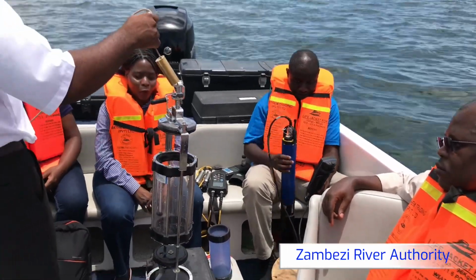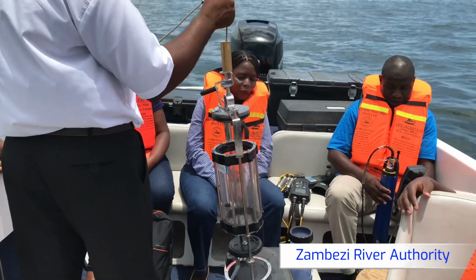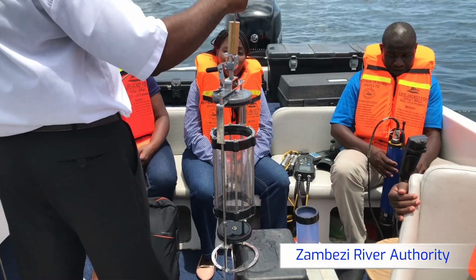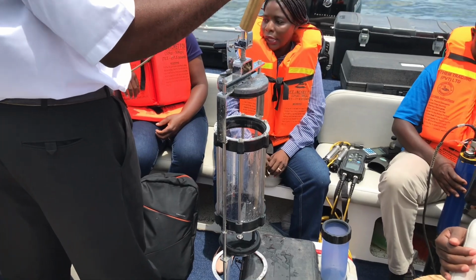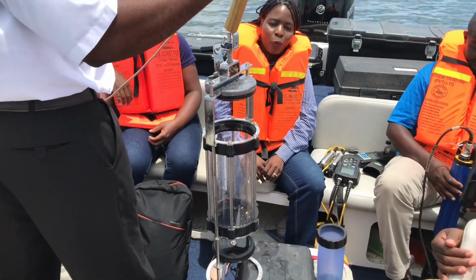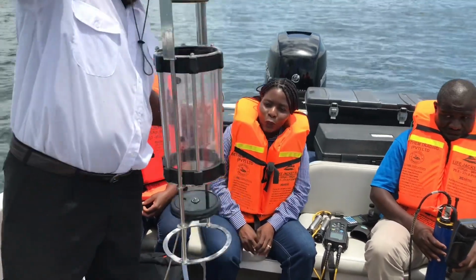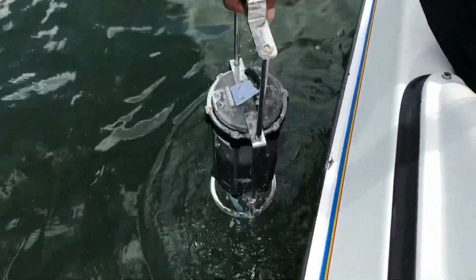Hello, our viewers, welcome back again. We sampled at 50 meters, and this is our sampling point called B51. We want to sample at 0.5 meter depth. So you will see the differences of the parameters that we mentioned earlier, and these are pH, dissolved oxygen, as well as temperature.